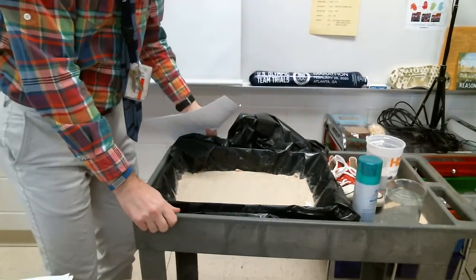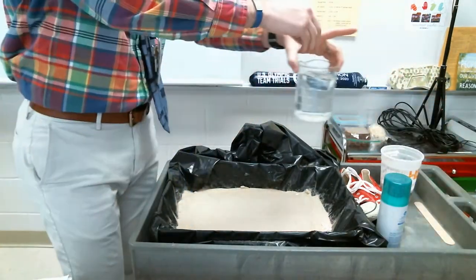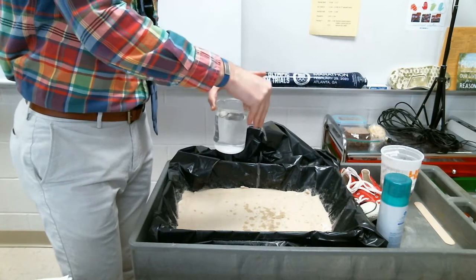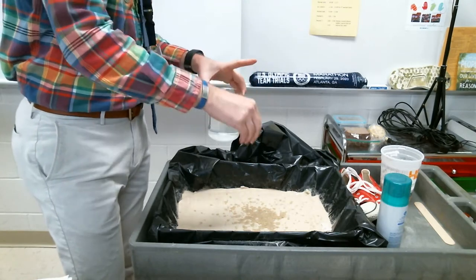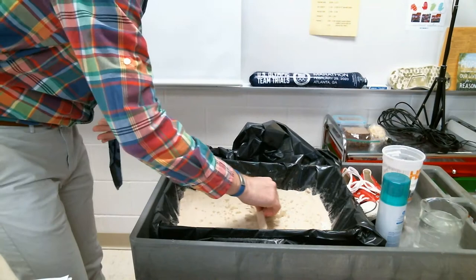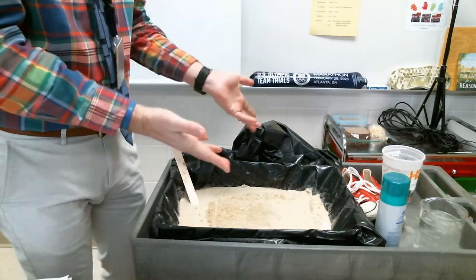I'm going to adjust my camera here and let you see the setup we have. We have some sand here and this is the surface we're going to use. I'm going to add some water to it just to kind of make it clump together a little bit more. By doing this, it's just making it so that any impression will be a little bit more visible in the sand — dry sand isn't going to hold an impression of a shoe pretty well. I'm just trying to keep it nice and even, and I am about ready to make my impression at this point.